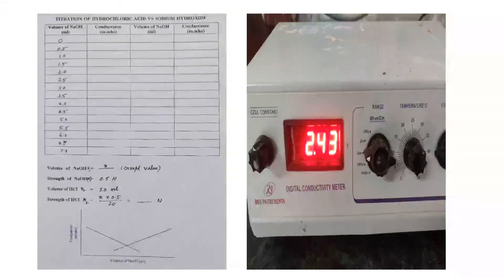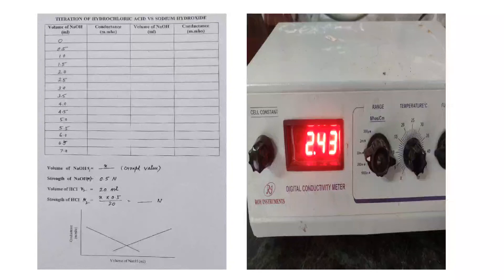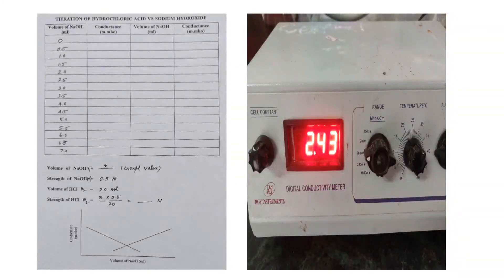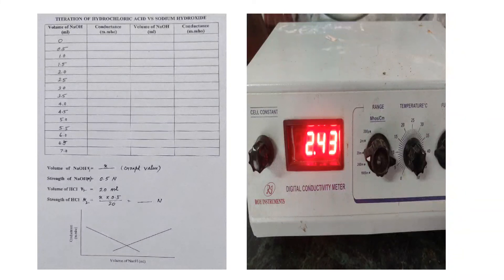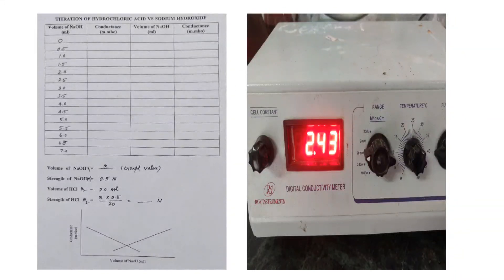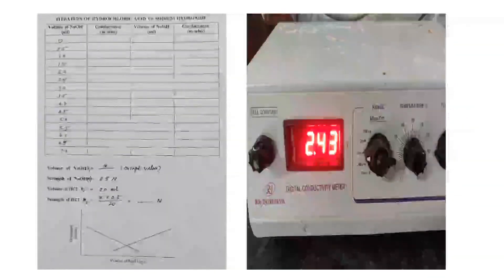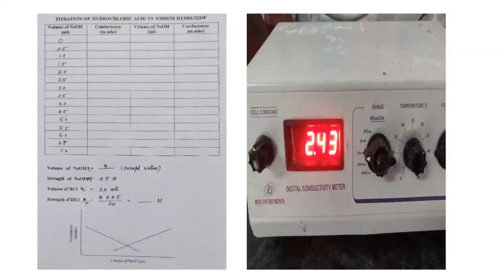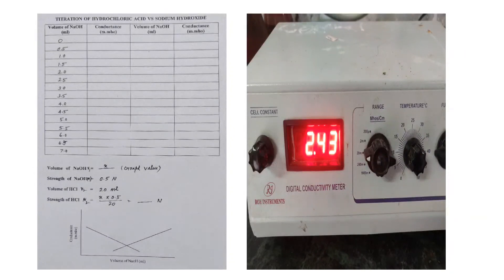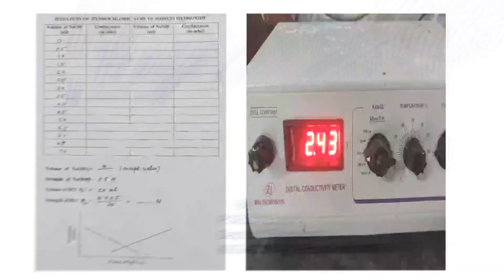Now we plot the titration graph of conductance versus volume of sodium hydroxide. By dropping a perpendicular to the x-axis at the intersection of the two lines, we obtain the volume of sodium hydroxide. This value is the concordant titrant value, from which we can calculate the strength of hydrochloric acid present in the solution.